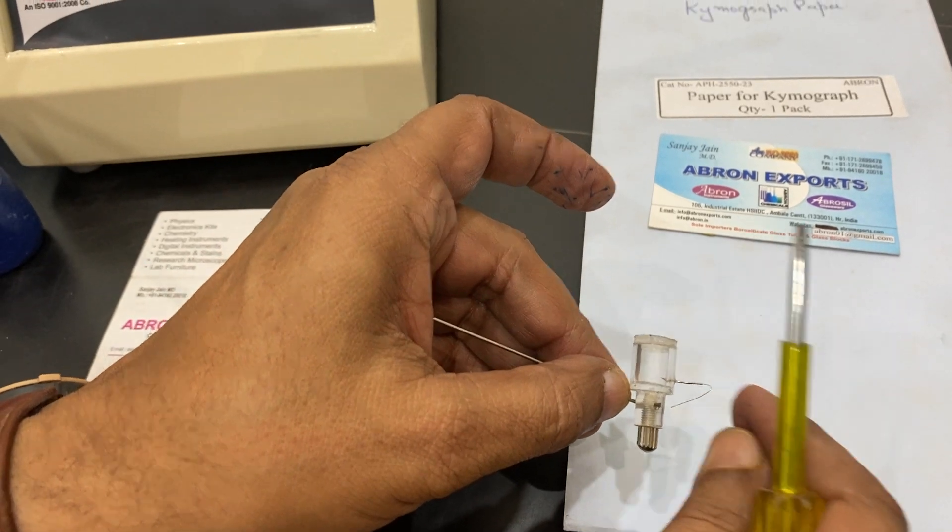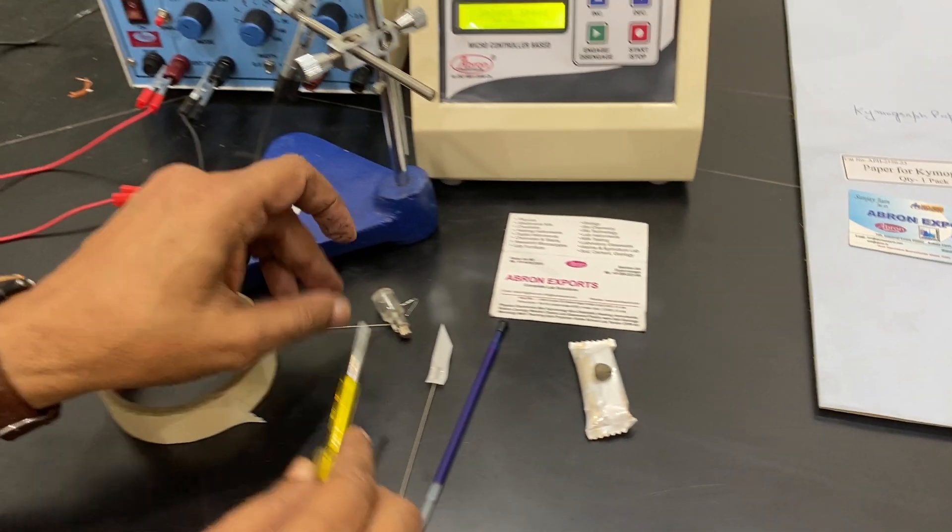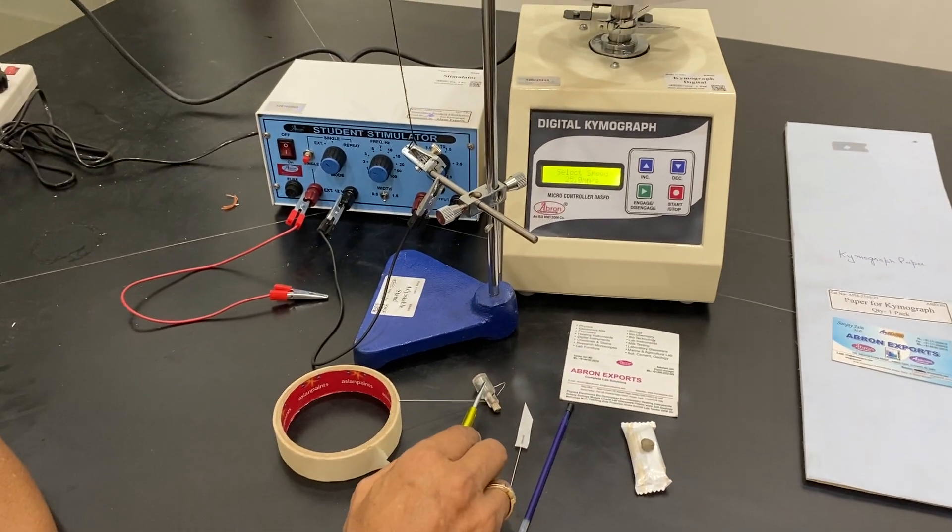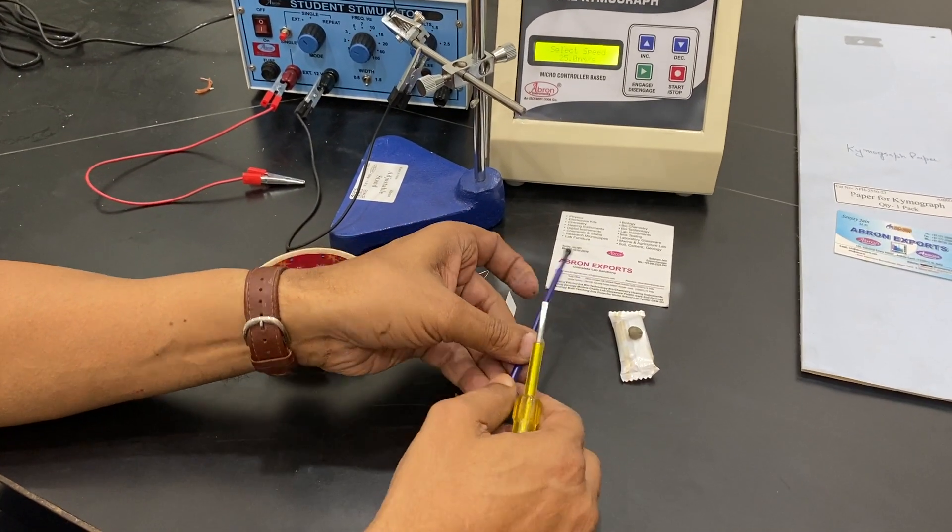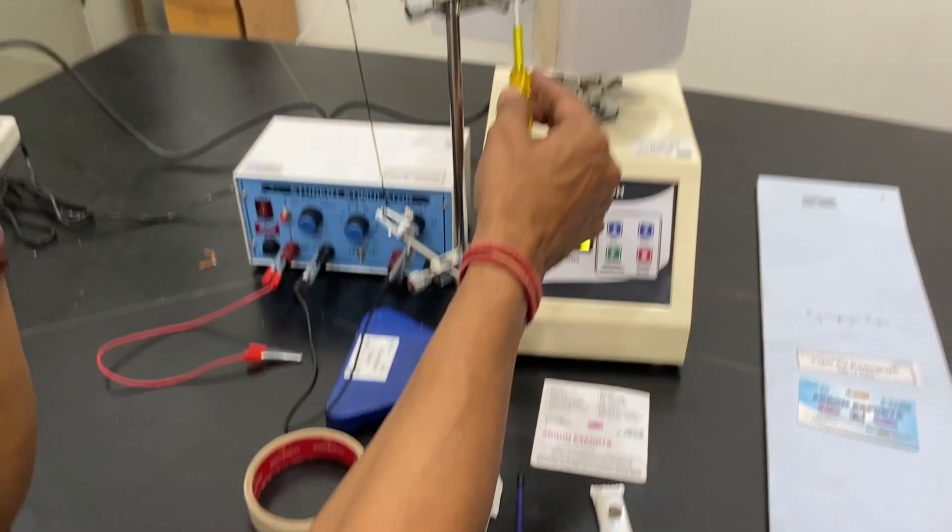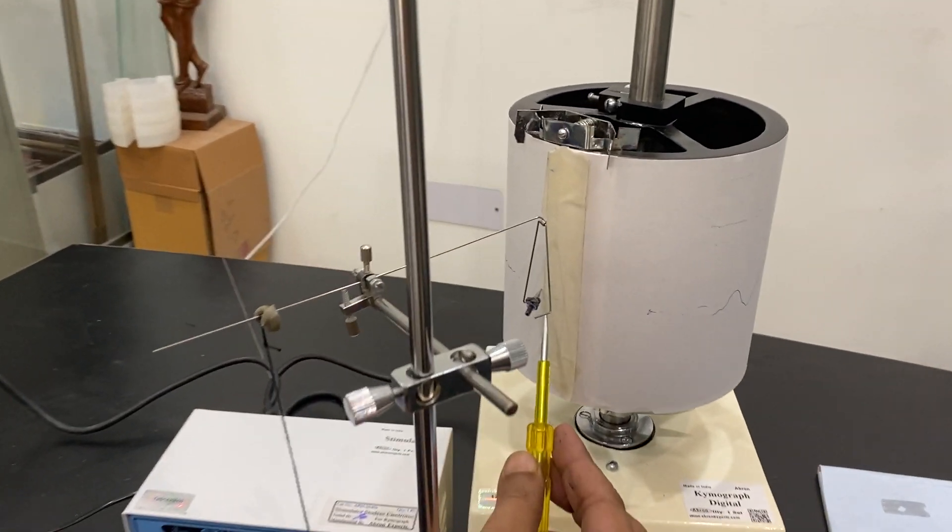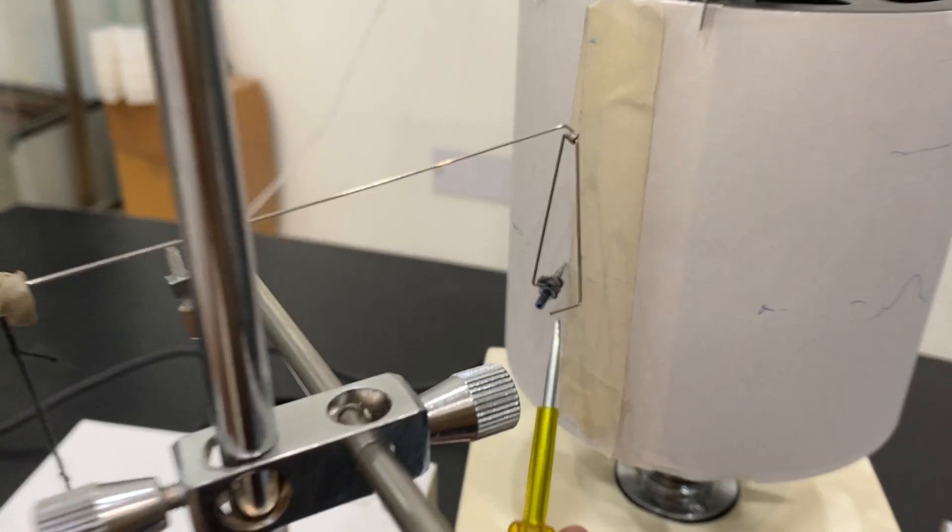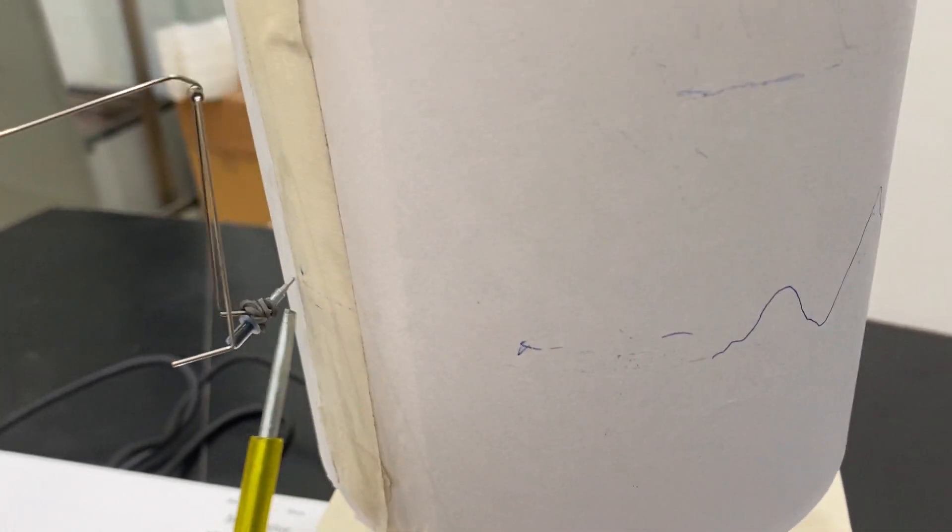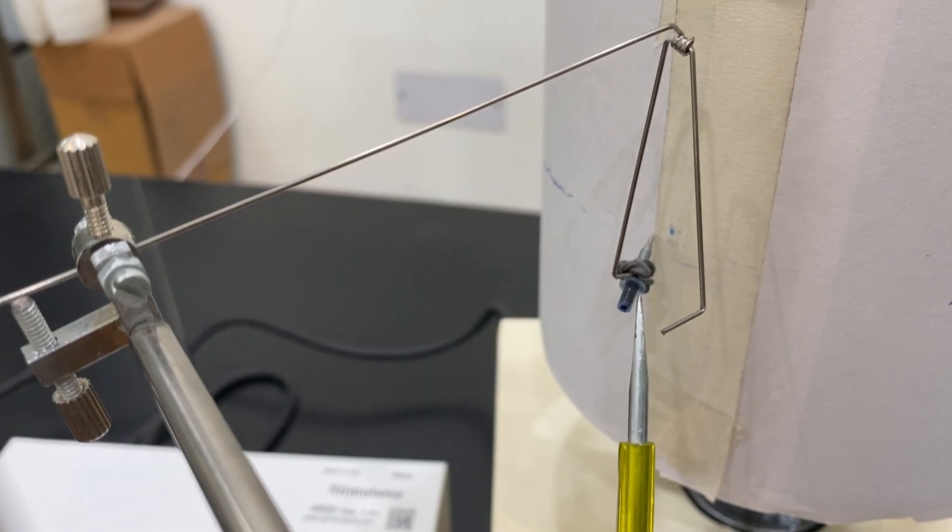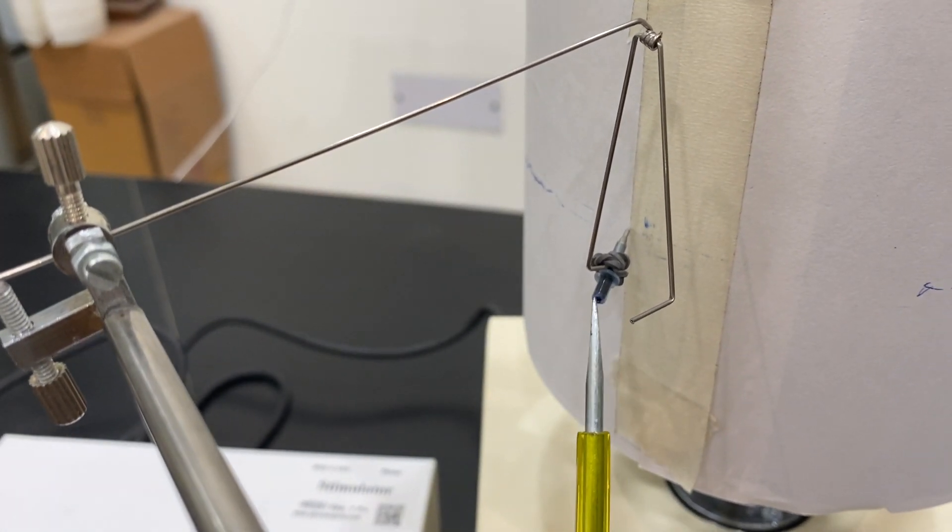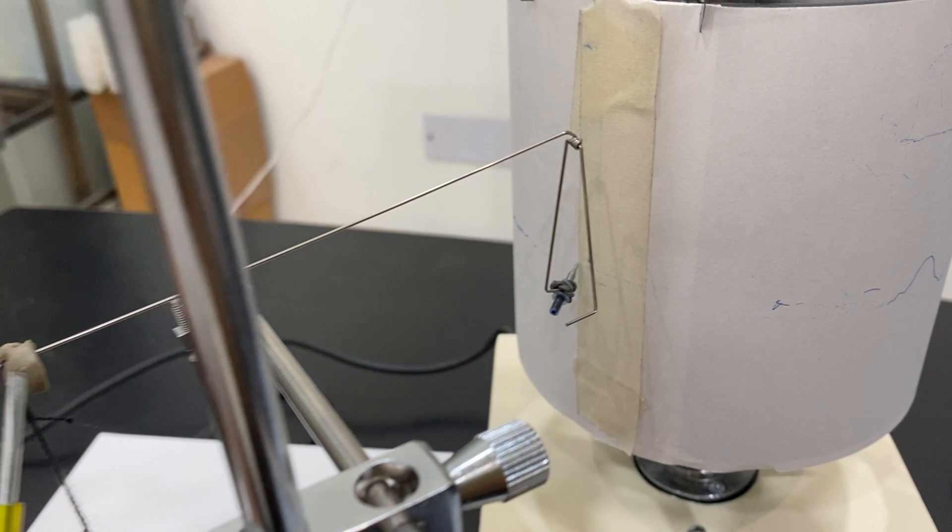You have to put it back immediately after use so that there is no leakage or blockage. What I have done is using a gel pen, only the top front part, and I have connected this with a rubber tube. Let me show you the close up. There is a rubber tube here and the gel pen tip is there.